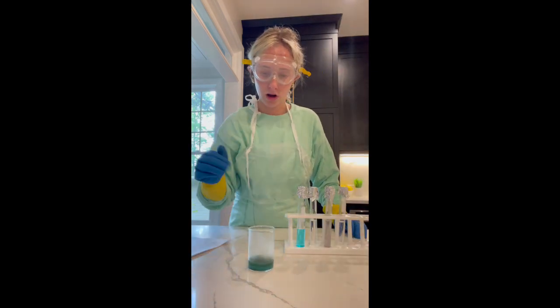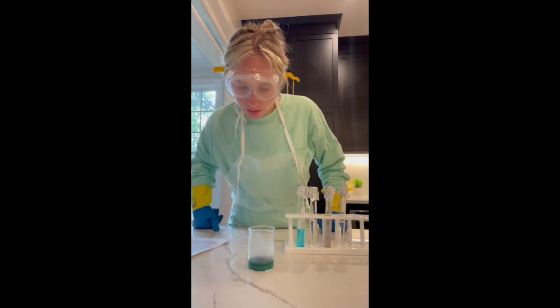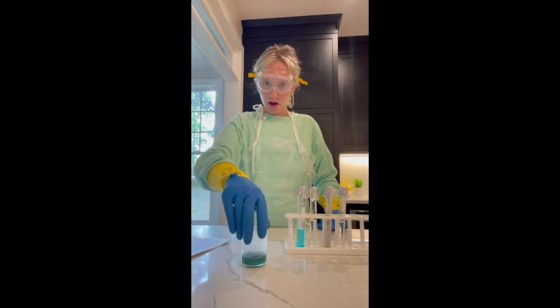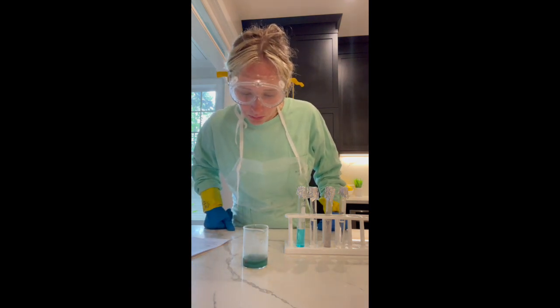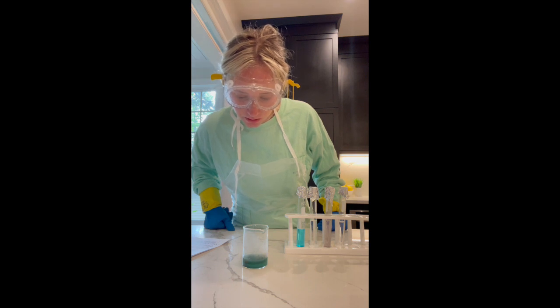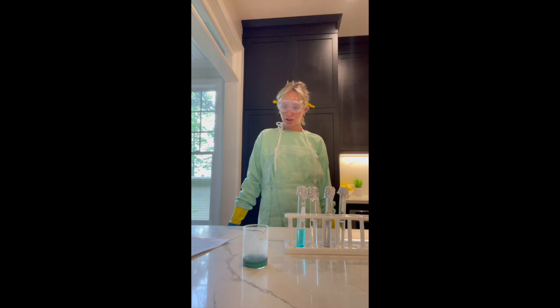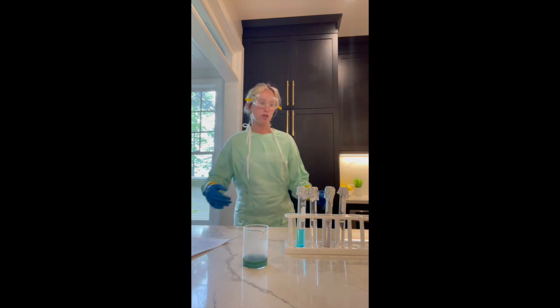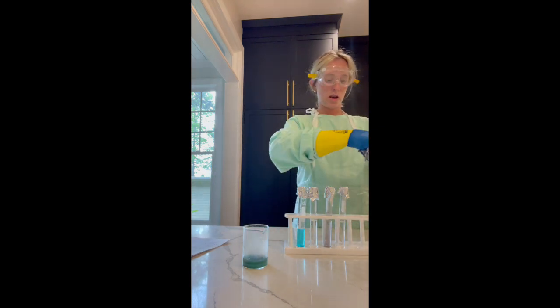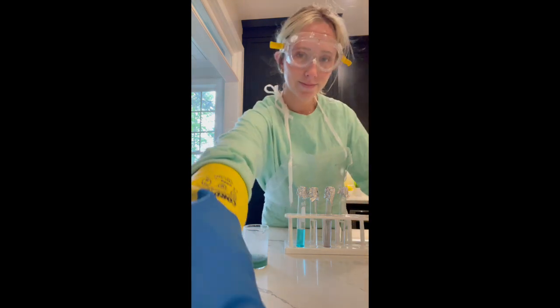Okay, so the aluminum did dissolve all the way, and it did turn the water a bit muckier, maybe a little bit greener. The bubbles did end up dying down. So I do believe this was an exothermic reaction along with a single displacement. So I'm going to cover this back up, and then we'll move on to reaction 1.